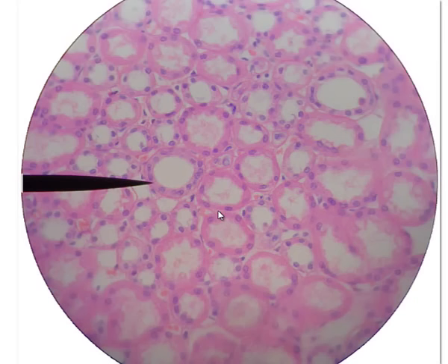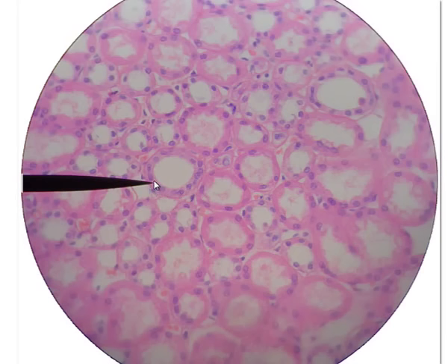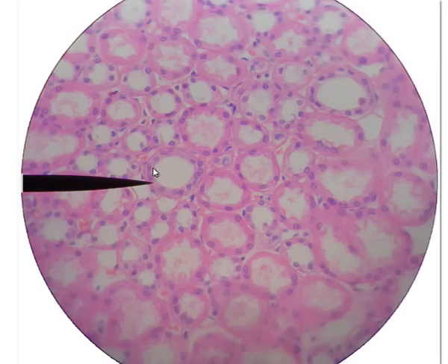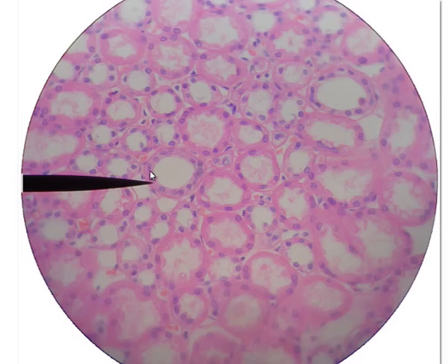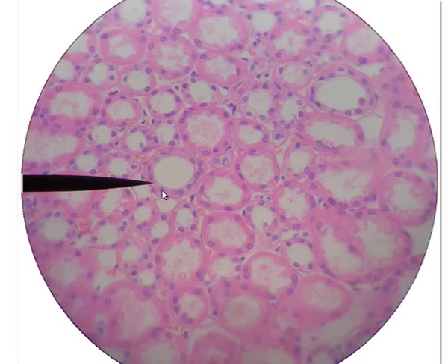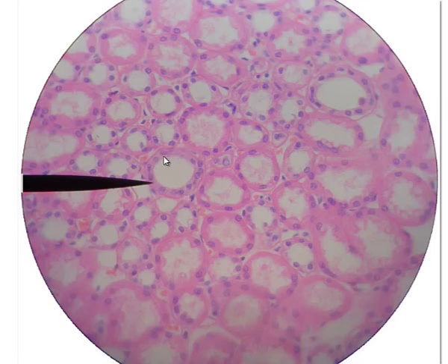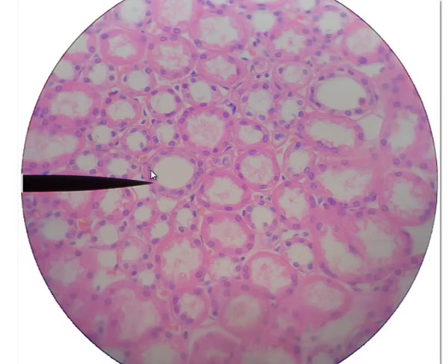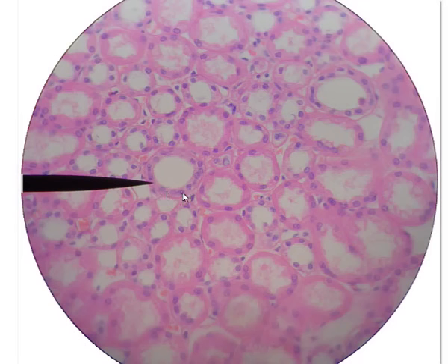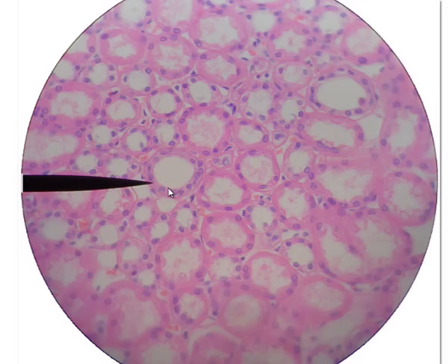Moving on — this should be another epithelial tissue. Looking at where the pointer is, there's one layer of cells going in a circle and these cells are not tall — they're cube shaped. So this is simple cuboidal epithelium: simple because there's only one layer of cells, cuboidal because these cells are more cube shaped. This slide happens to also be from a kidney — these are tubules from nephrons.